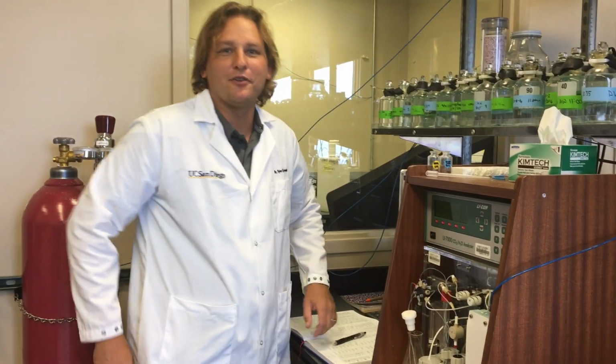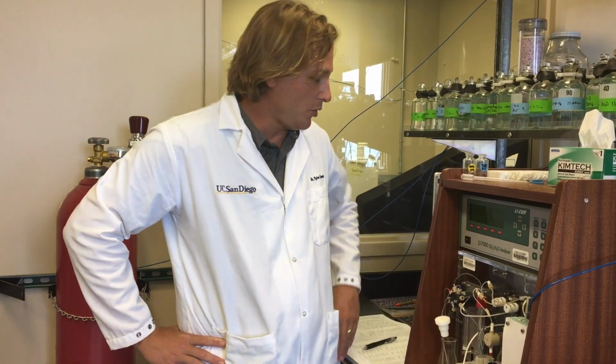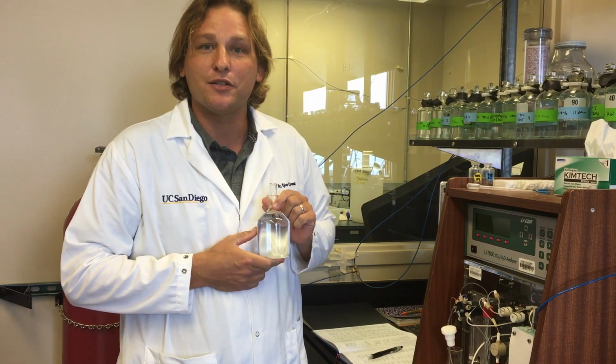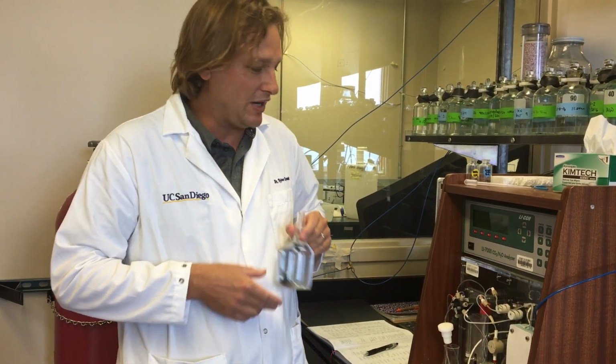Well, hello students of Del Norte High School. My name is Dr. Tyler Cyranek, and I'm a postdoctoral researcher here at Scripps Institution of Oceanography in the Scooby Lab, and we measure the carbon dioxide chemistry of seawater. You caught me at a perfect time, because I was just about to measure the carbon dioxide concentration of this sample right here from the Great Barrier Reef.